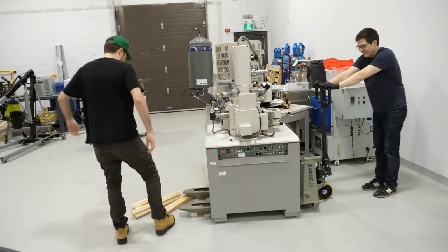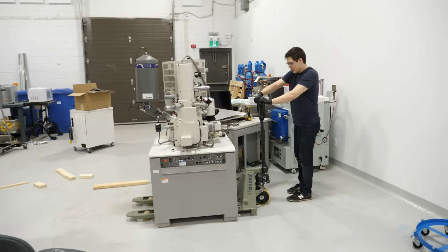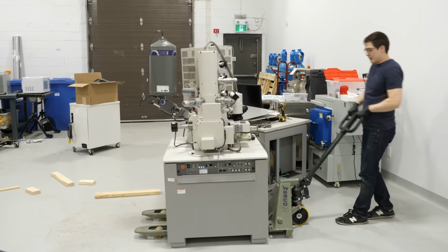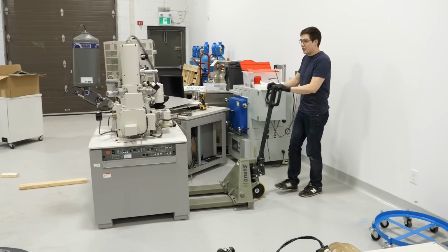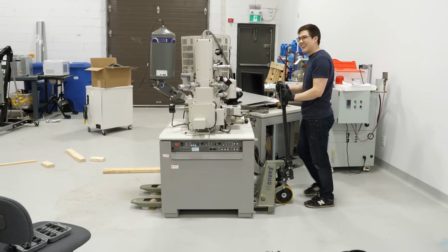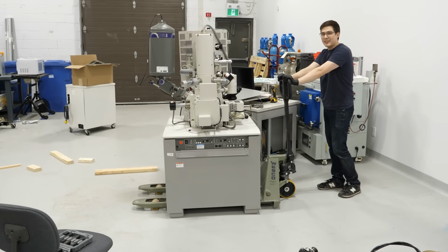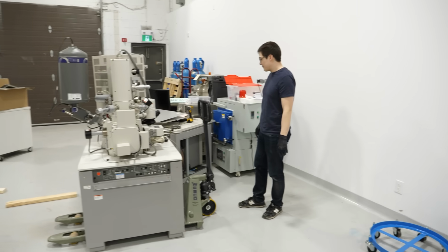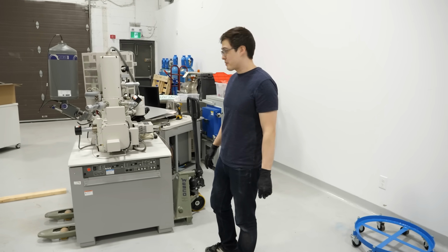Just running it over. So like here, look. Oh, shouldn't have done that, but look. Oh yeah, okay. Go anywhere. Well, it's a little stuck because of the ground. Oof. Yeah, just a bunch of monkeys with a microscope. Okay, I mean... Nice. Could have gotten 10 times worse.